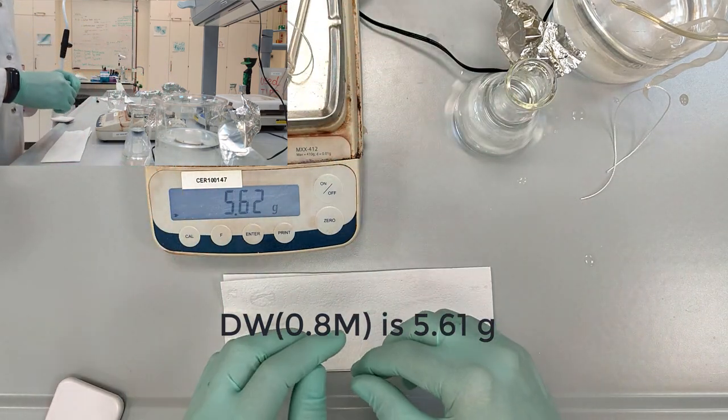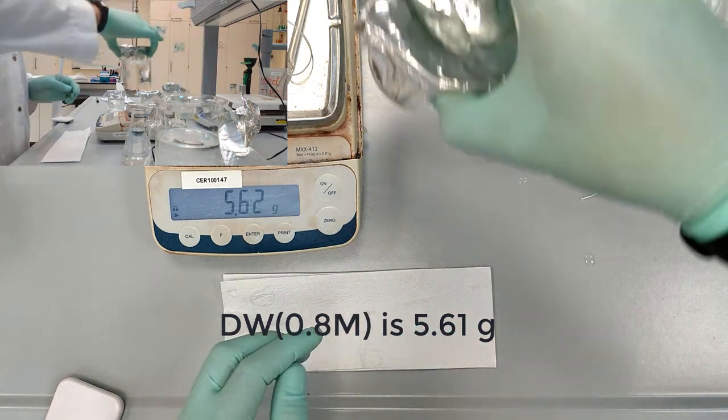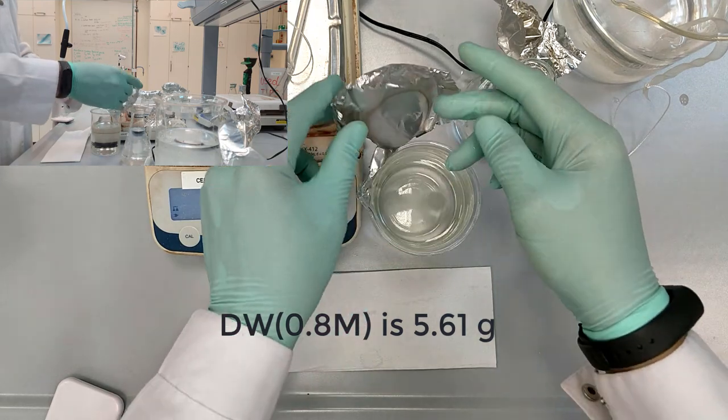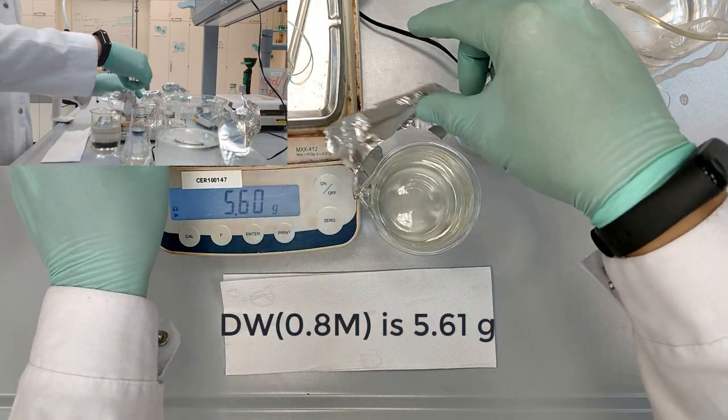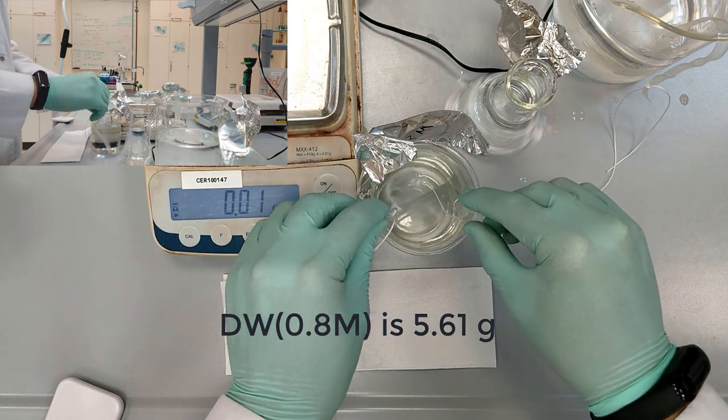This tube weighs 5.61 grams and we put it inside the beaker with 0.8 molar glucose.